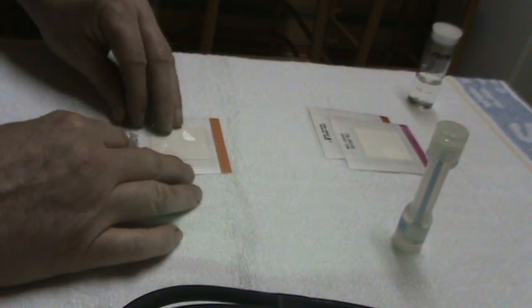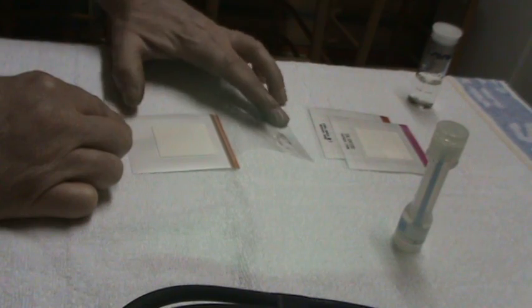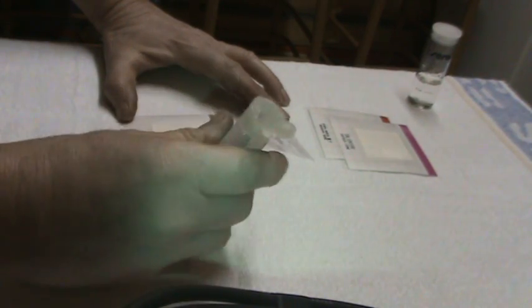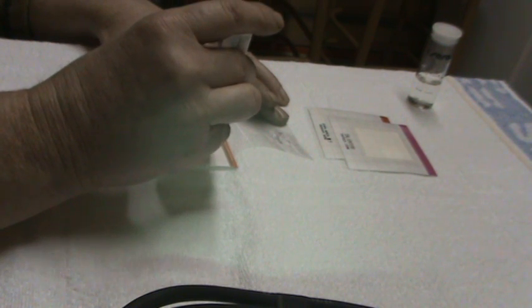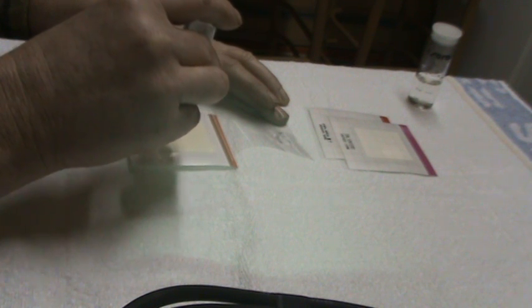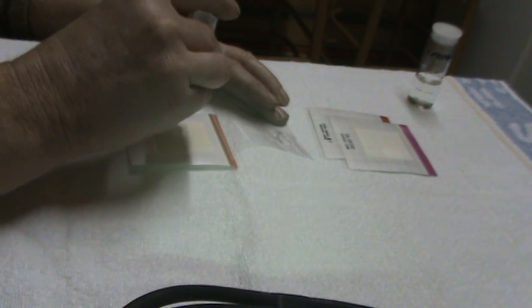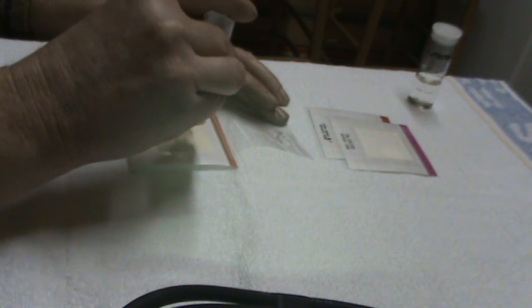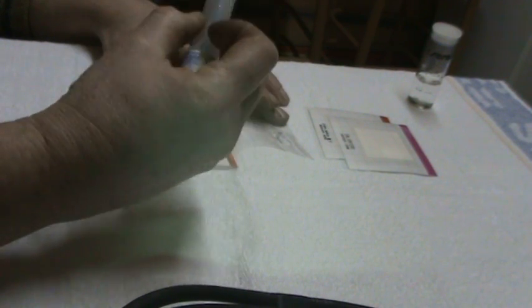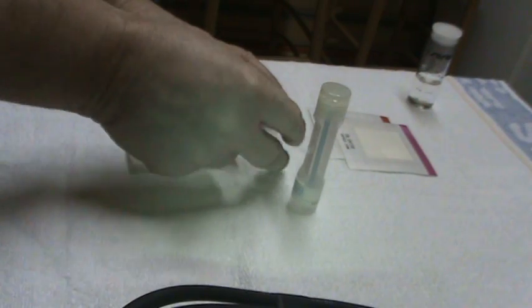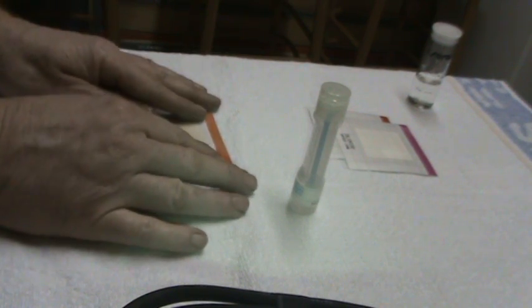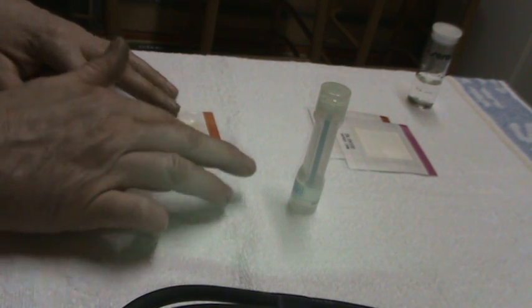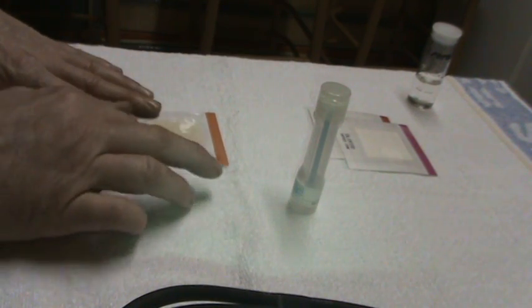That was total bacteria. Now I am going to make the same thing for salmonella. Again, you lift the foil covering the medium, open the top of the swab bottle, divide one milliliter of the sample over the slide. Close the cap and close the foil. Again, make sure no air is kept between the layers.